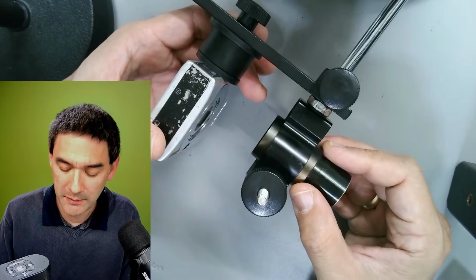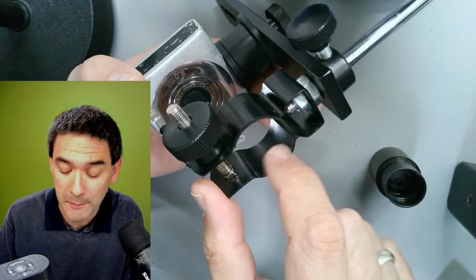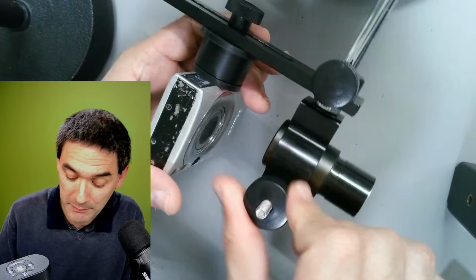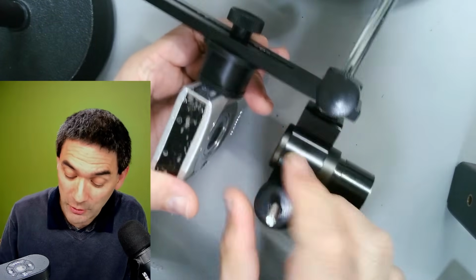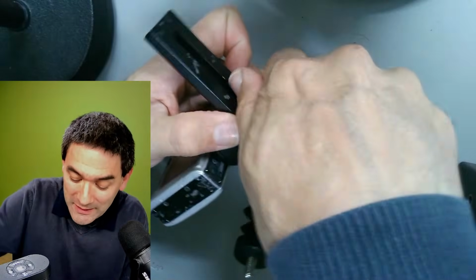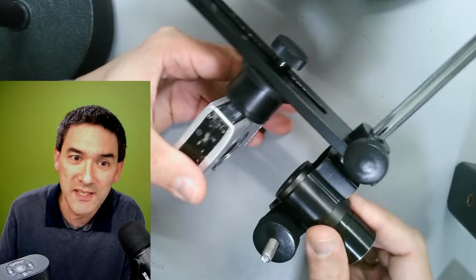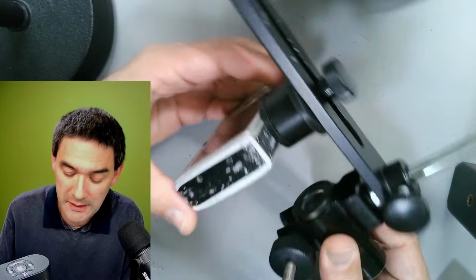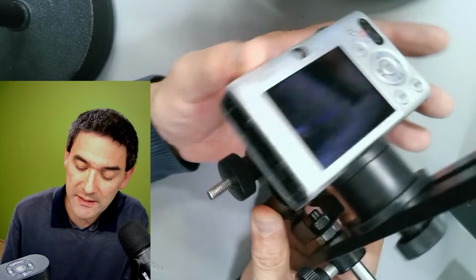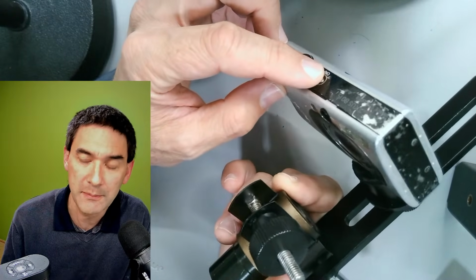The people who designed this really considered everything, because there's a rubber padding in here. When you clamp it closed, this is what I call German engineering. If you tighten it, it's absolutely locked in place. There is zero wobble. And the nice thing is that with this camera, because there's a zoom capability, if you zoom in, you do not see the image in a circle, but you actually see it full.